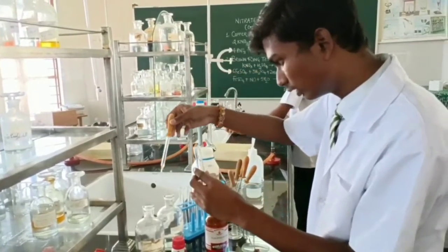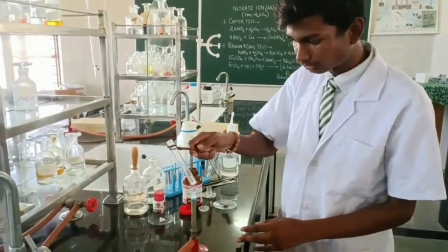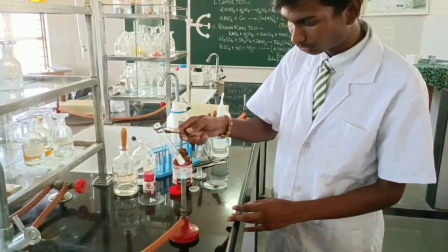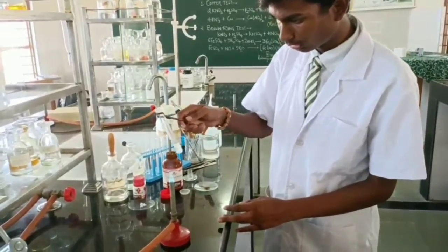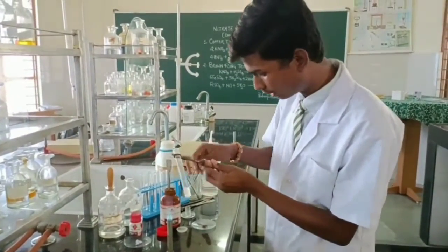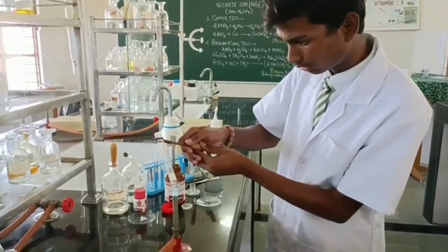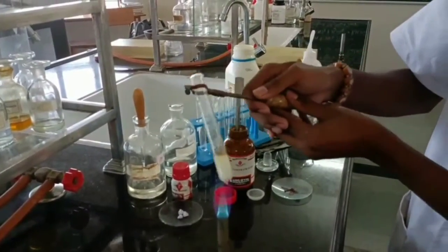Yes, a lot of sulfuric acid is not supposed to be added. A little bit. Now you heat. So salt plus concentrated sulfuric acid, gentle heating. Remove the test tube, no continuous heating. Heat and remove, then again heat. The solution should not pop out of the test tube due to continuous heating. Heat and then add copper chips to it. Copper again works as a reducing agent, same activity as your paper ball was doing. Yes, now heat. And after heating you can see again you will get the brown fumes.